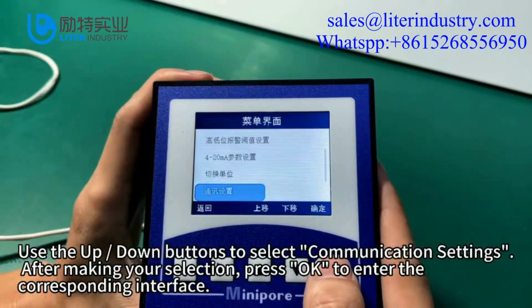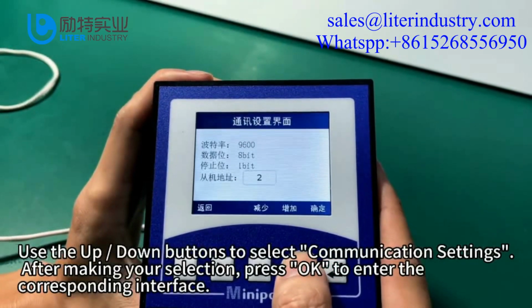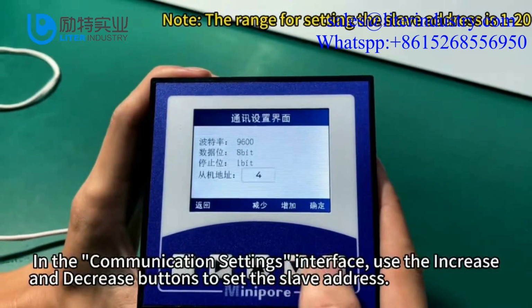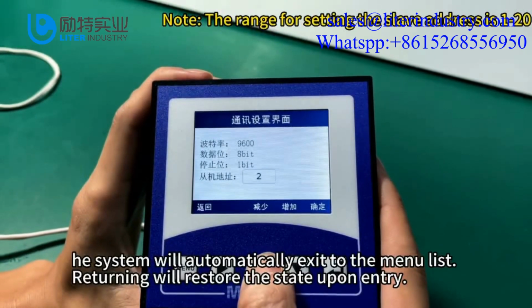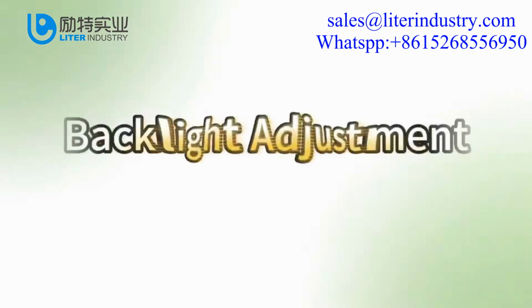Use the up-down buttons to select communication settings. After making your selection, press OK to enter the corresponding interface. In the communication settings interface, use the increase and decrease buttons to set the slave address. Press OK to save the settings. The system will automatically exit to the menu list. Returning will restore the state upon entry.